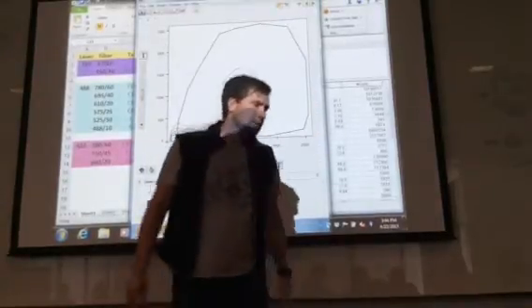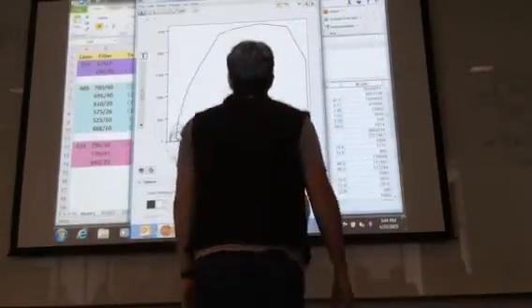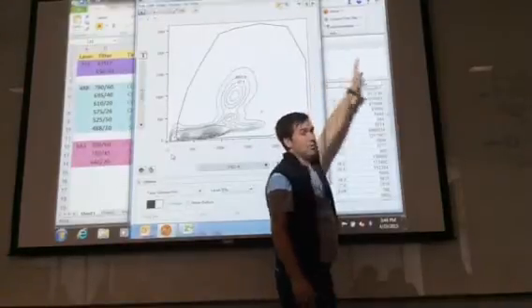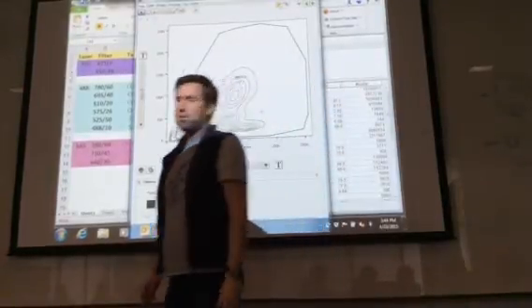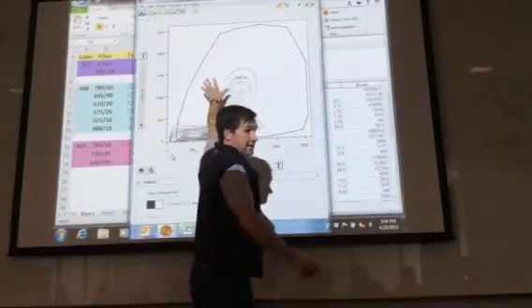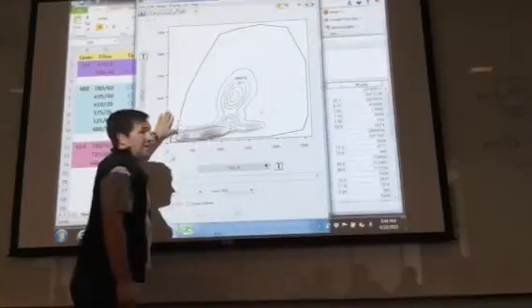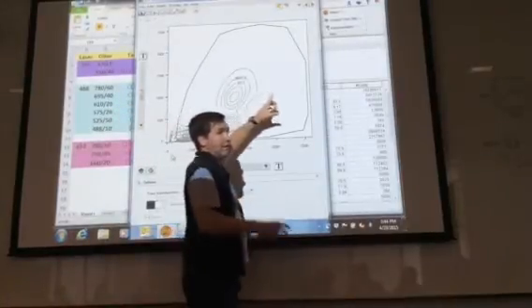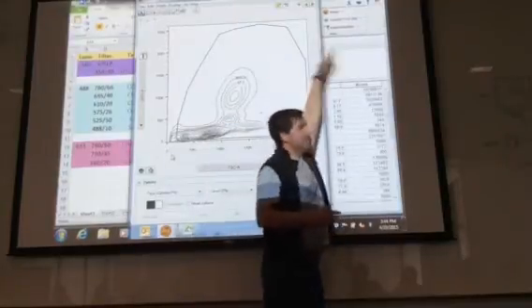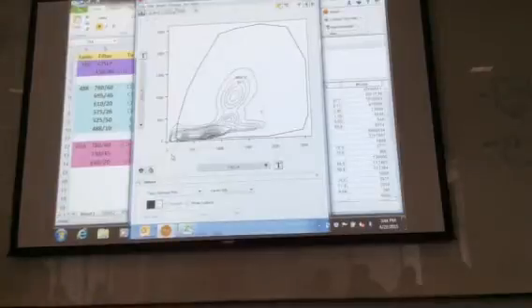Why does mine have this large debris on the side? I can't reproduce what I did, but I think that's what I did. You don't want that. Anything that goes off the scale like that, that's why you gate off of the forward scatter and side scatter like this. It allows you to get rid of the debris that either exists down here, or in your case, there are large clumps of cells recognized there, and it's all off here. It's much larger in size and much more granular.